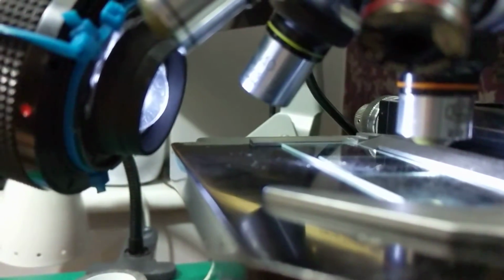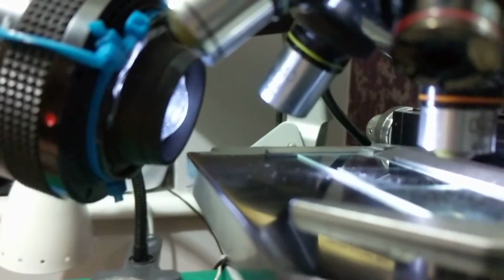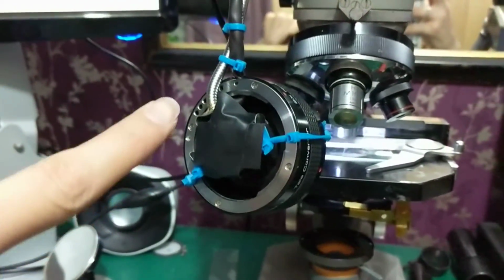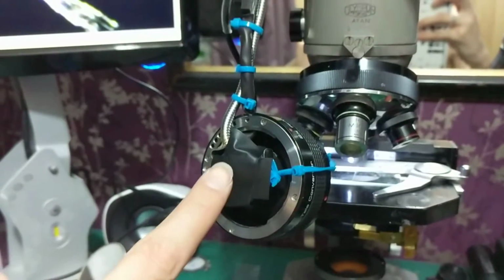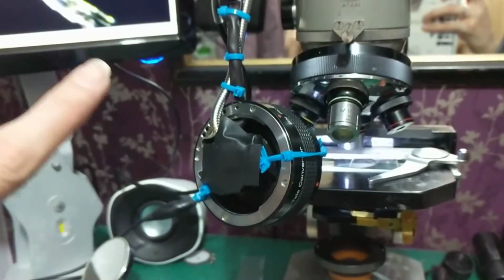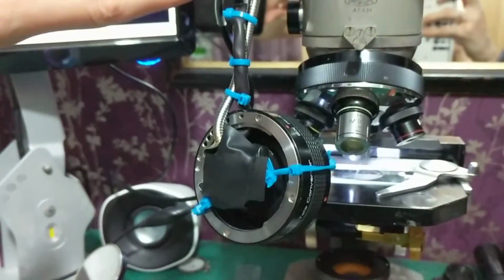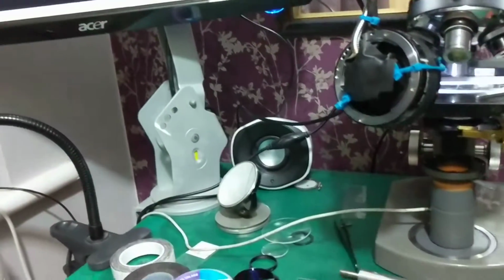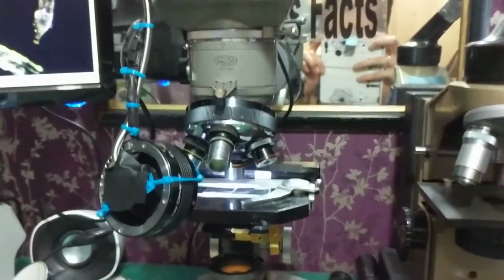The angle isn't great, and of course it's only coming from one side, so there's a lot of contrast, which is great for some things but not for others. What I then did is I've also soldered a USB lead onto the back of the LED, which came from a torch, and put the switch a little bit further up so I can control it, and that's then plugged into the computer or any other USB power source.